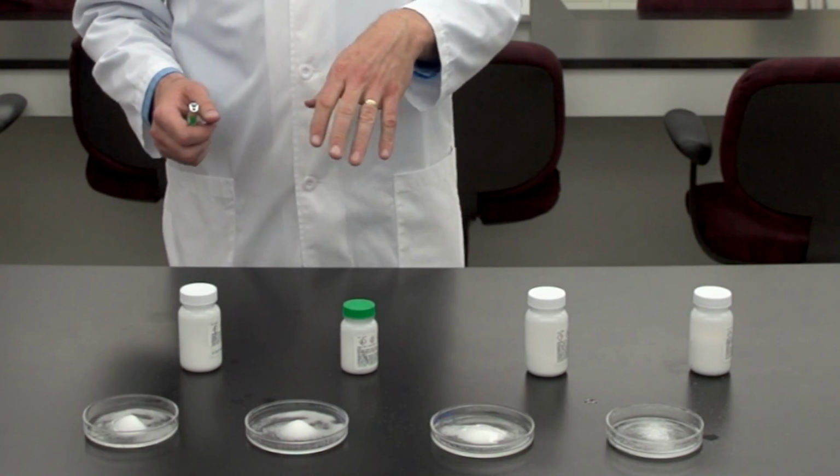And in with those salts I have a little bit of methanol. And so what I'm going to do is I'm going to light the methanol and then take some observations of what's occurring as the methanol burns down to the salt.